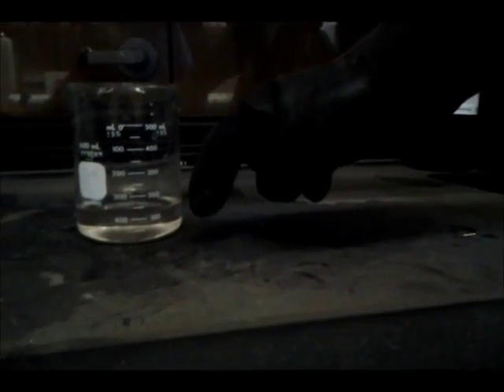And then once you're done with that, you want to get a beaker with silver nitrate in it, and you want to go get some copper. First step, all you do is set the copper into the silver nitrate. And you wait about four to six hours and wait for the product and the solution to come.